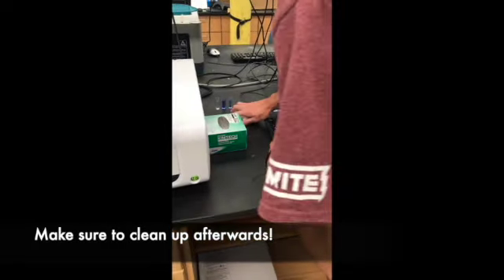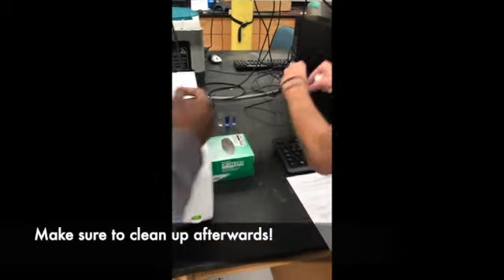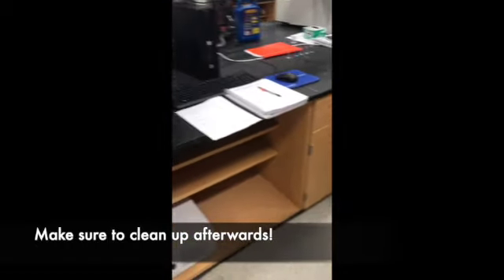After completing the procedure, make sure to clean your workspace and also make sure to clean your lab space in the other room.